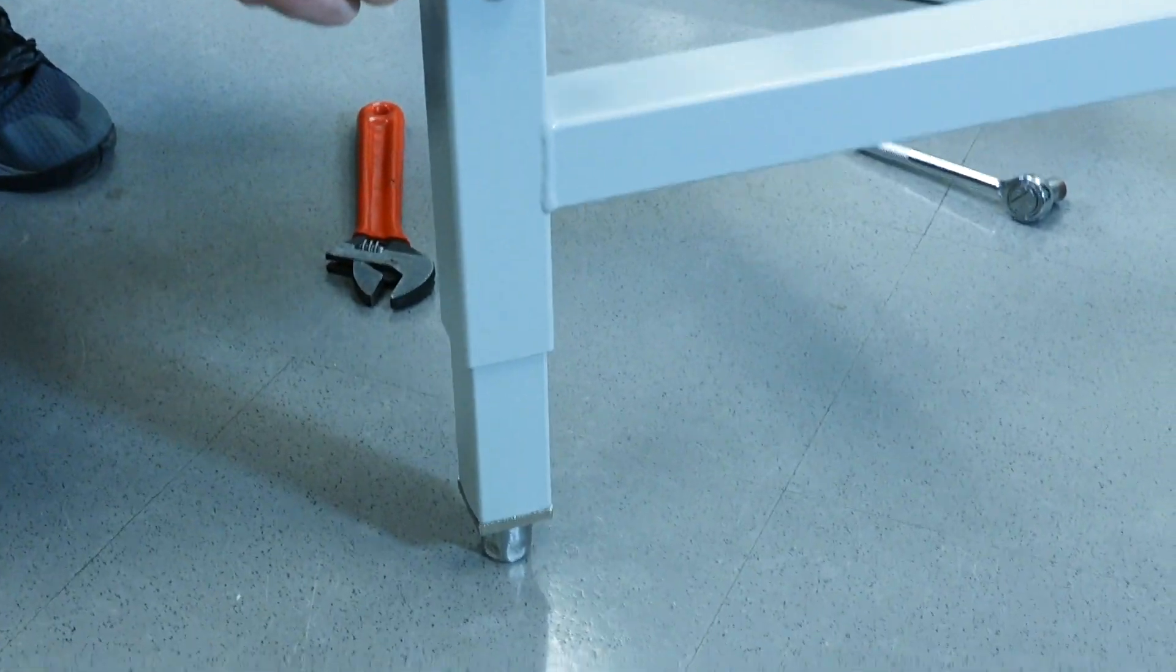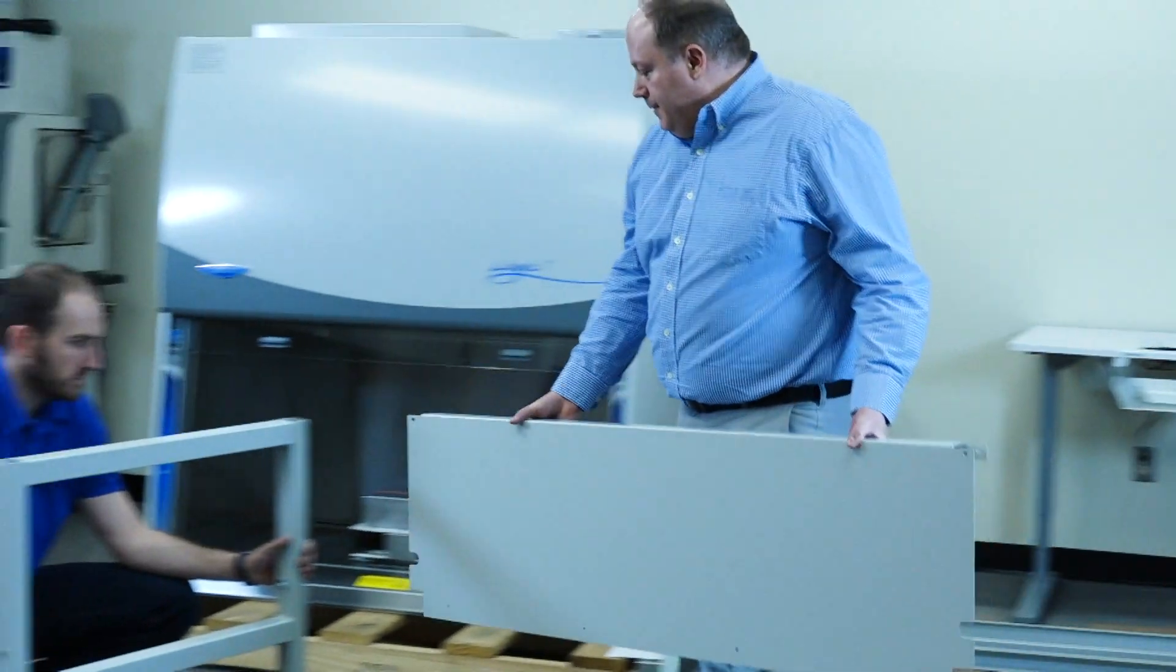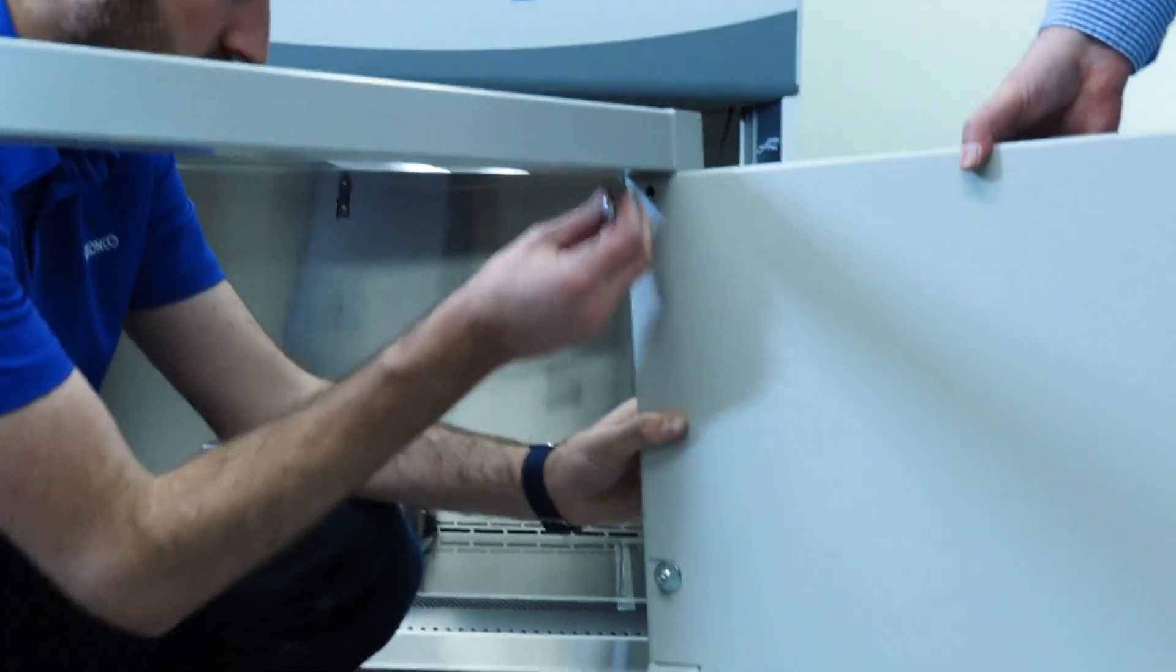Over-tightening can warp the base stand legs, which prevents future leg adjustment. Ensure that all legs are at the same height before continuing.